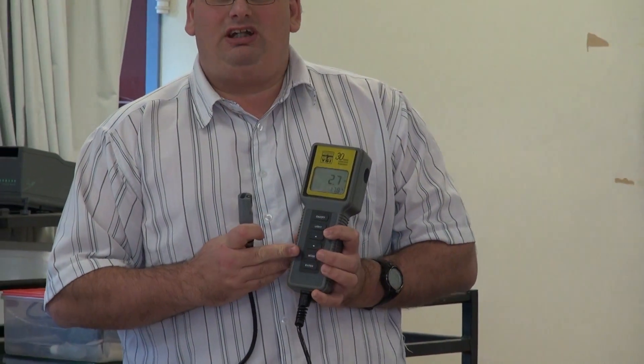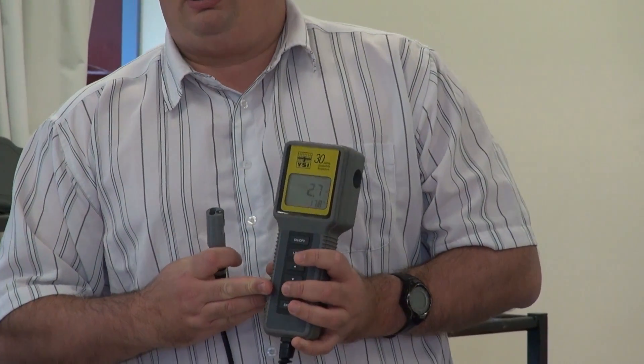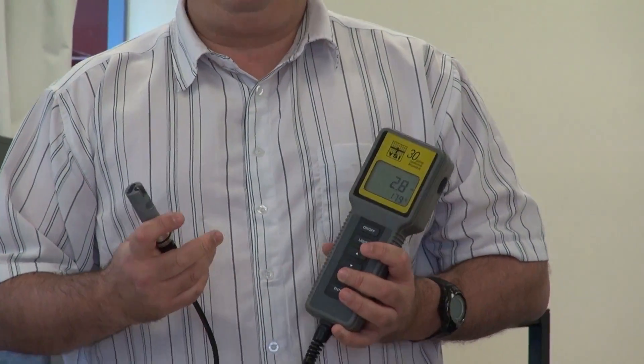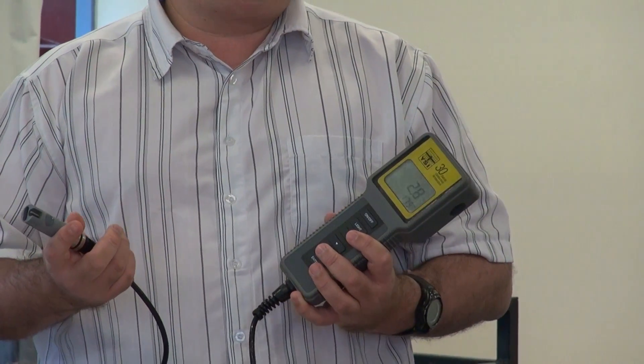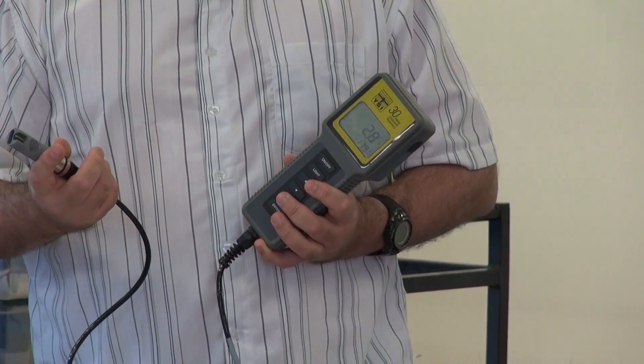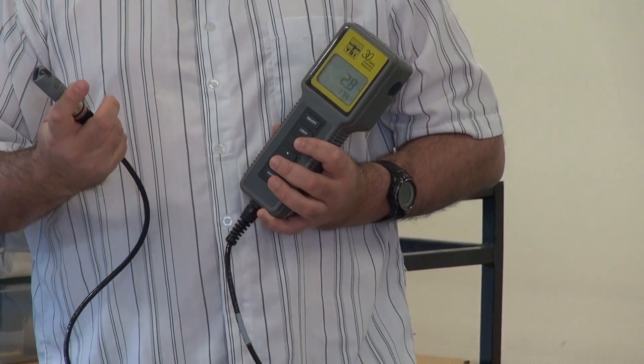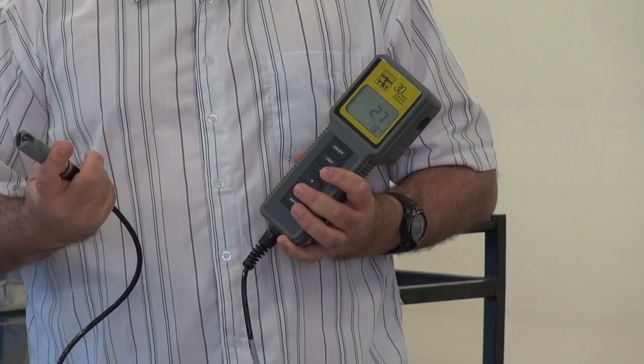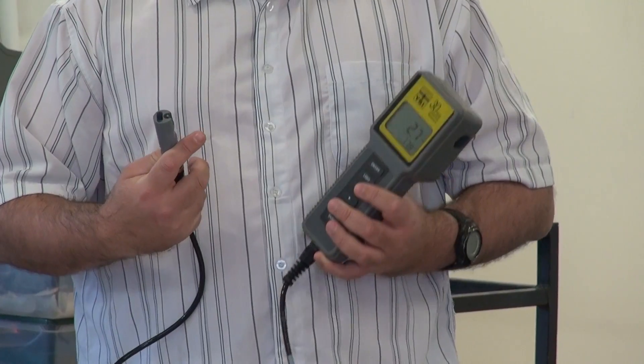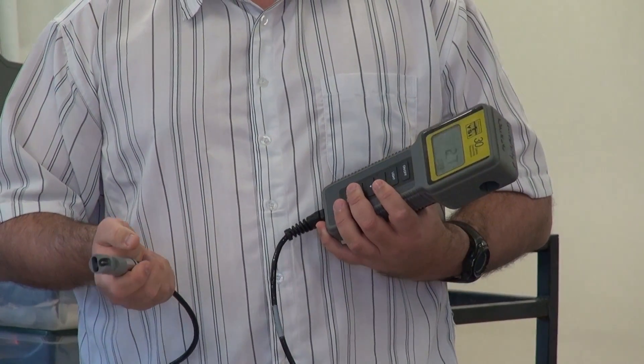With the conductivity, you generally don't have to worry about calibrating it. They should be calibrated every six months to a year depending on how often you use them. I wouldn't worry the students about doing that. The technicians would probably take care of that. These ones were done by Ray about six months ago.